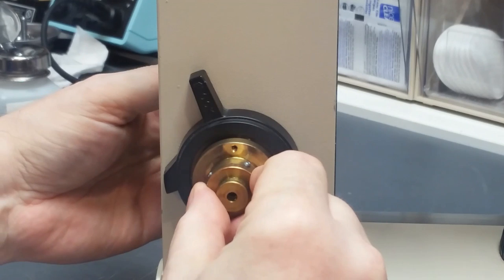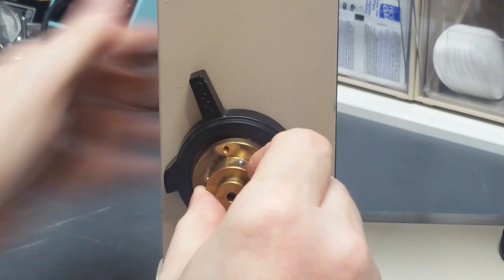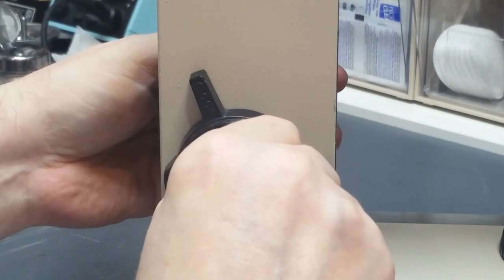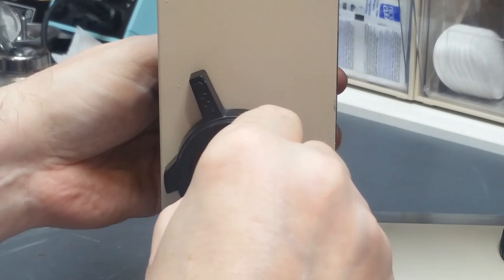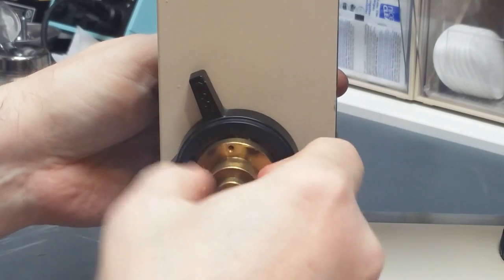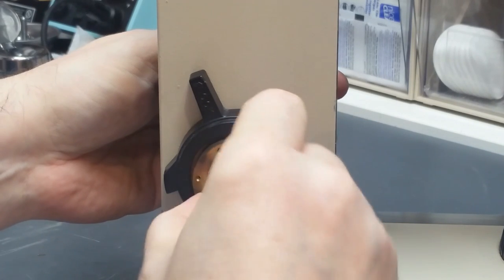Hold that right in position up against that shaft, which is protruding. Now what I do is I pull the shaft out behind so that this brass piece seats as far forward as it can. What I have to do now is rotate this thing clockwise, and in so doing, that's preloading that spring, and it'll eventually rotate back around until the pin contacts the other pin on the disc that rotates.